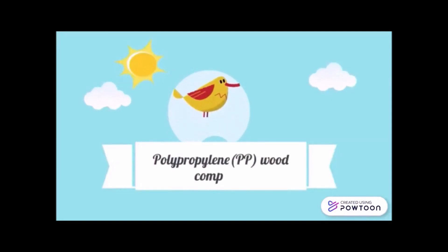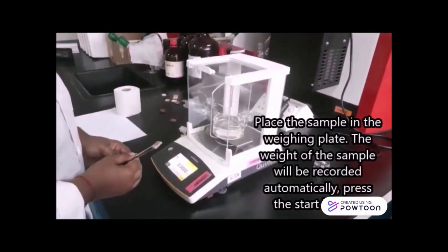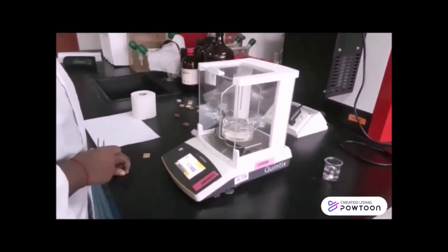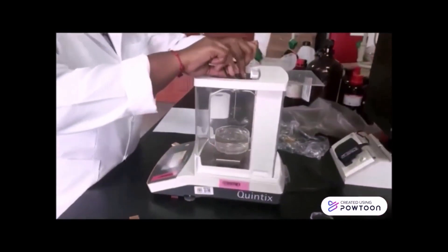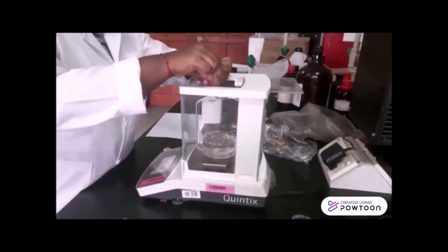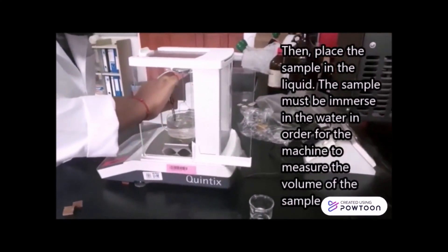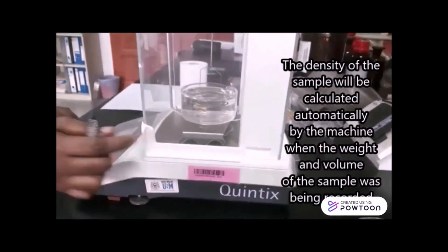Now we repeat the same steps for the polypropylene wood composite. In order to measure the weight of the sample, we place it on the weighing plate. After the weight is recorded in the machine, remove the sample. Then place the sample in the liquid. The sample must be immersed in the water, or else the volume will be inaccurate. After that, the density of the sample will be calculated automatically by the machine.